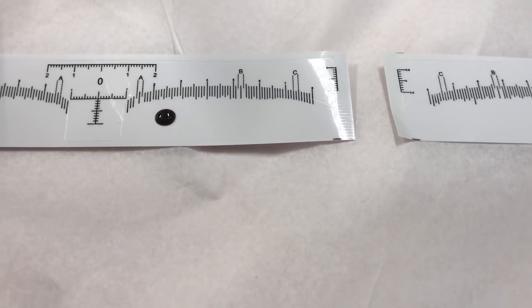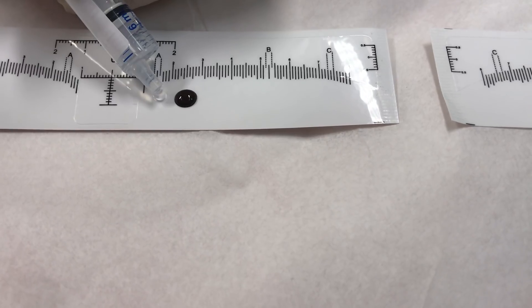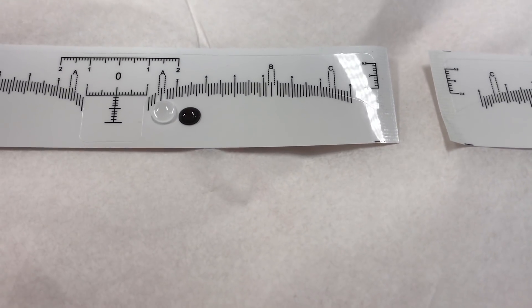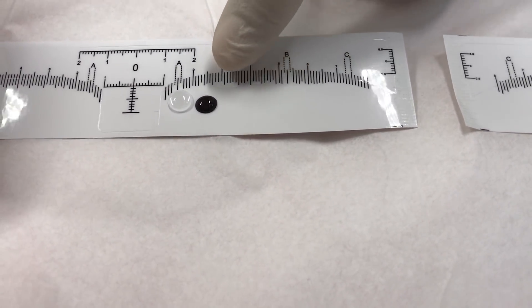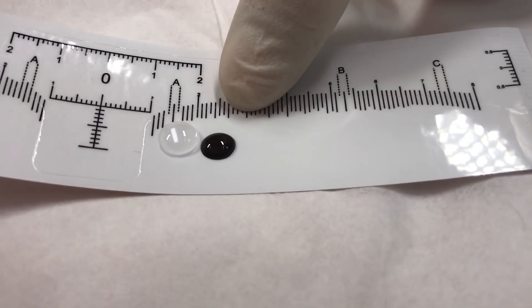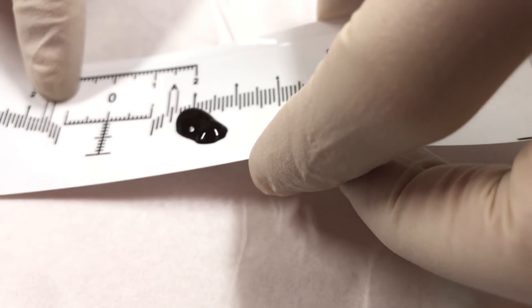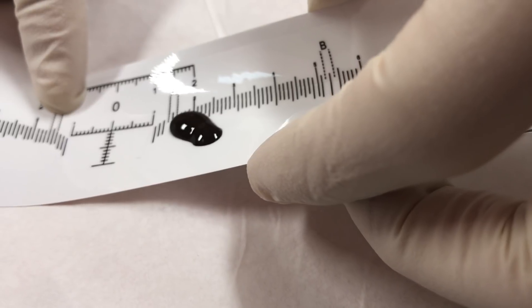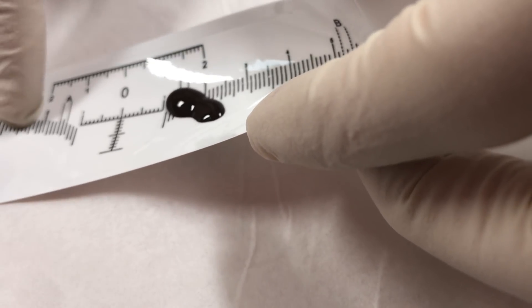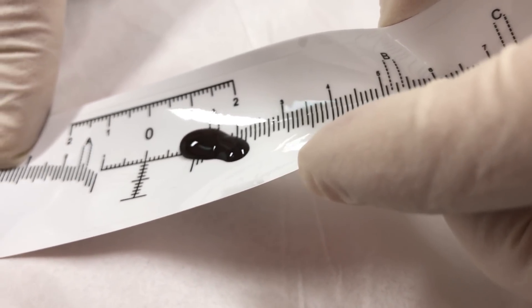But look at this one. I'm going to apply my chemical right here. Now I'm going to gradually make it come into contact. You see the reaction happening? That pile of pigment will be going soon — boom! Actually in a test tube you would see it going crazy, it's like burning. You see? This one has a lot of iron oxide in it.